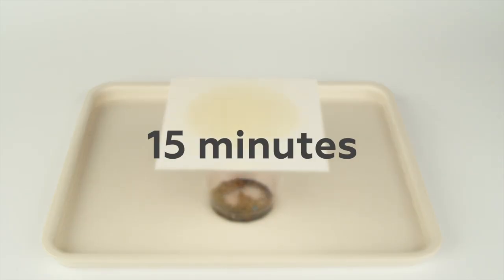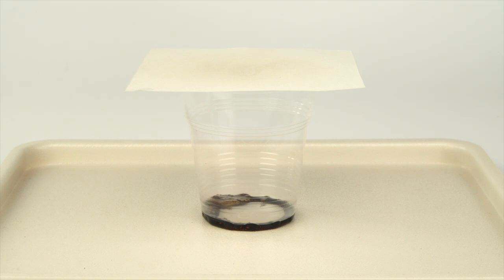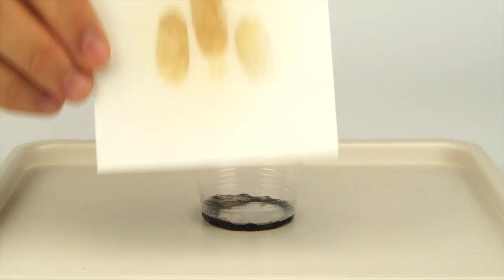Check your paper in 15 minutes. You'll see your fingerprints distinctly on the page.